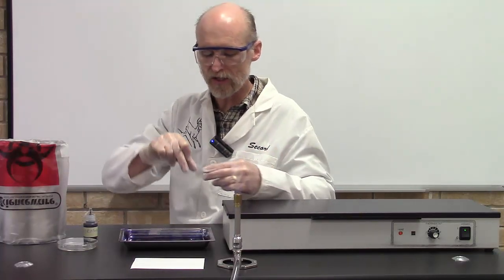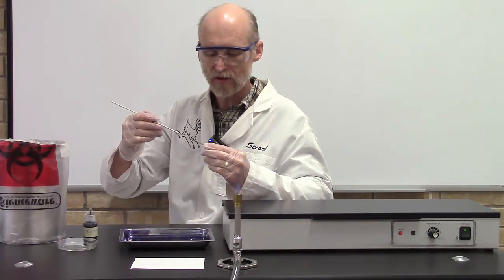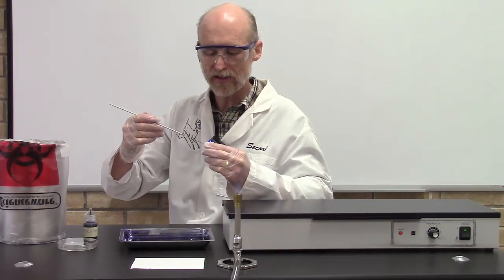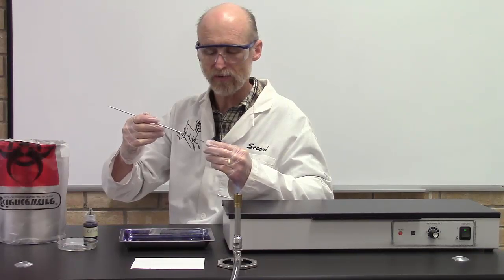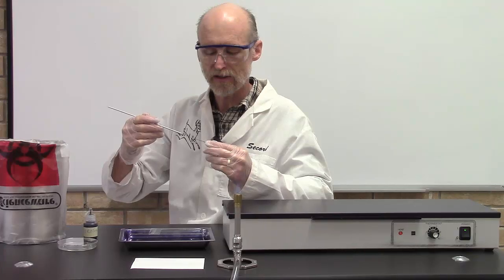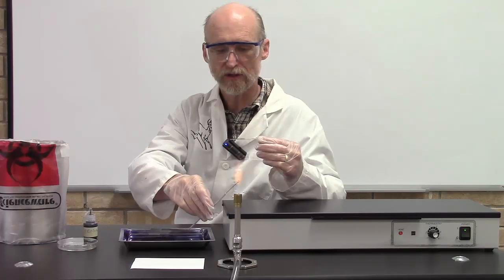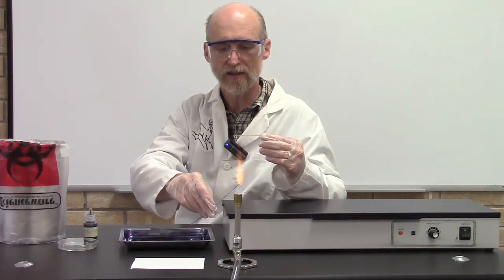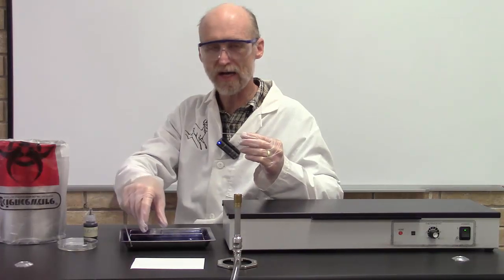I'm going to stir these into the dye drop. But when I stir it into the dye drop, I'm just going to stir it side to side. I'm moving the drop laterally as I'm mixing the bacteria into it. Stay away from your finger. You don't want to get the bacteria all over you. Now, immediately flame and cool your loop to destroy the excess bacteria. And now you're ready to spread out the dye.